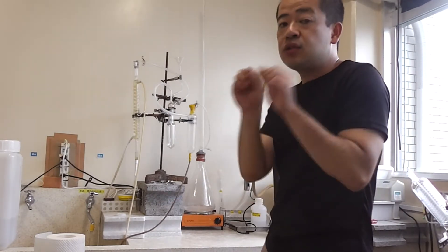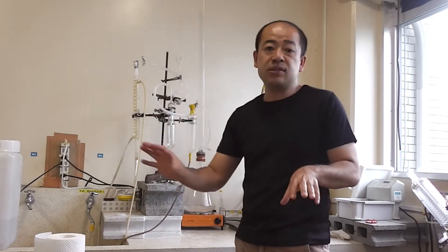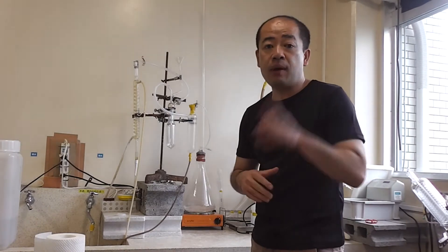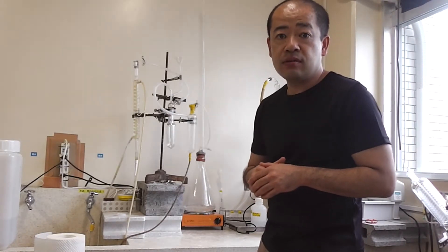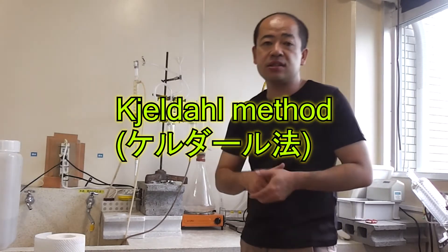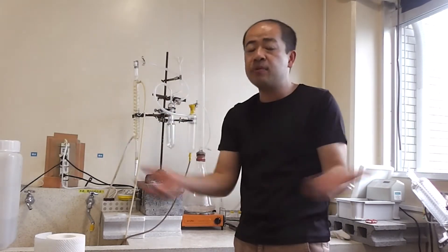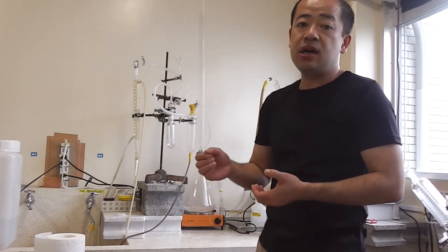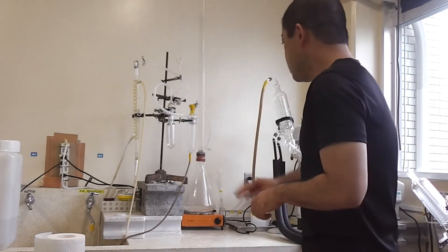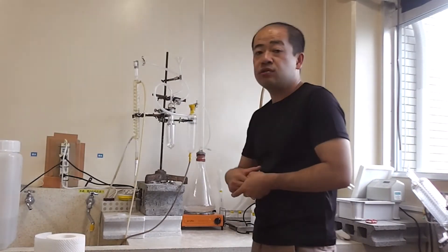Anyway, we need to analyze the nitrogen or protein in the diet or within fish bodies. In that case, we can apply one method. The name is the Kjeldahl method. This is an official method for analyzing protein not only in fish fields, but also everything like meat or some environmental samples. This is one of the apparatus used to analyze protein concentration.